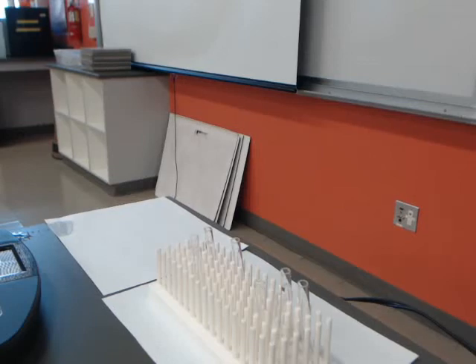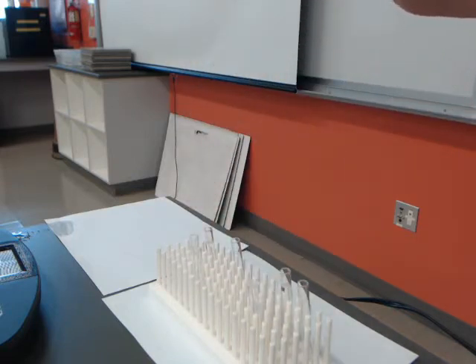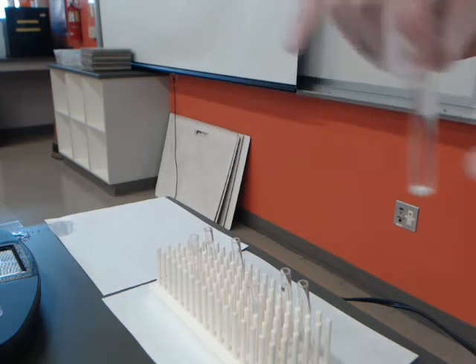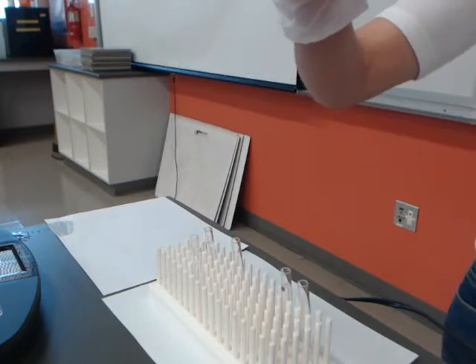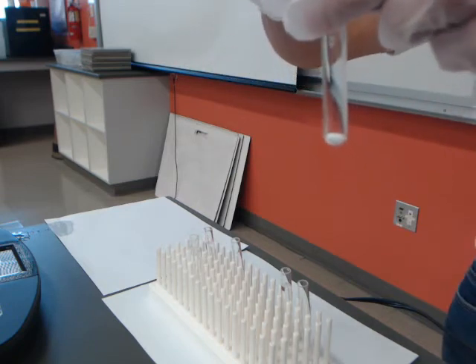Okay, we're on part 2, observing changes of substances when mixed. And test number 1, you've got a test tube with some sodium chloride in it. So there's some sodium chloride solid at the bottom there. And then I've got some liquid water. And I'm going to mix the two of these. So the water is going to get poured in.